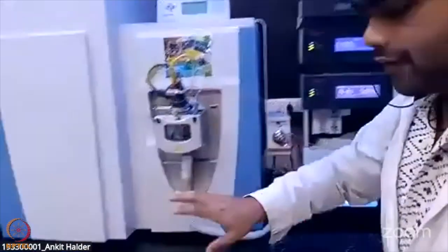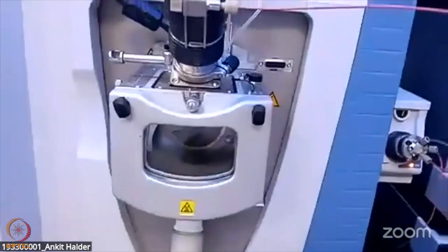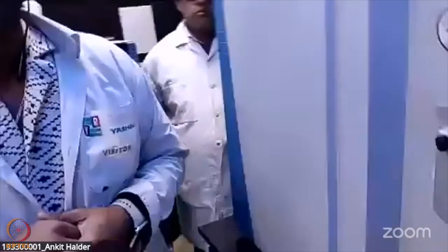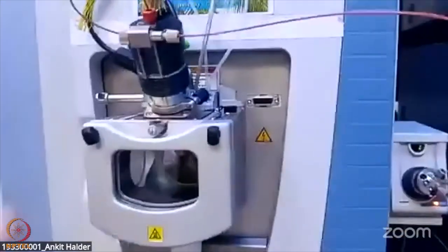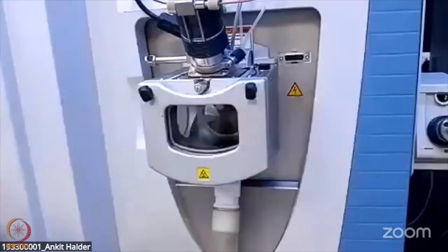Now from the HPLC, we have one of the most important mass spectrometers here, that is the QE. As sir said, there are two different mass analyzers: one is the Orbitrap and one is the quadrupole. The very first thing you need to know, as you have already learned in your courses, is what hard ionization and soft ionization techniques are. Within soft ionization, there are techniques like MALDI and ESI.